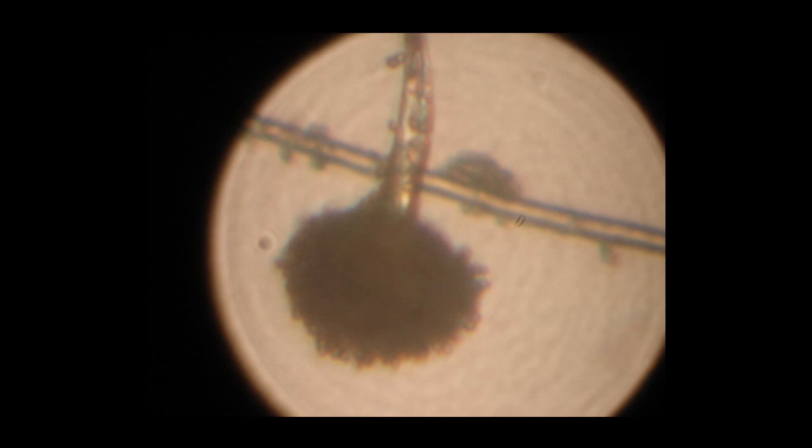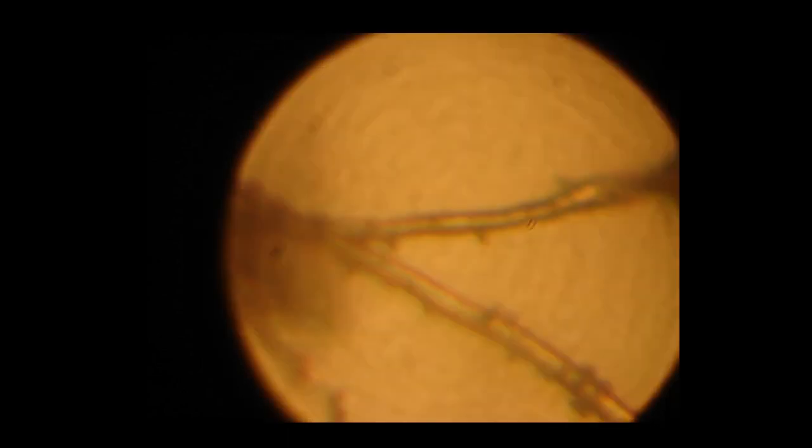This was the fungus that was infesting the carcass and I could not actually find any inner tissue. But this fungus by itself is rather interesting.